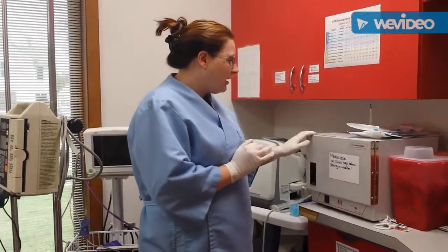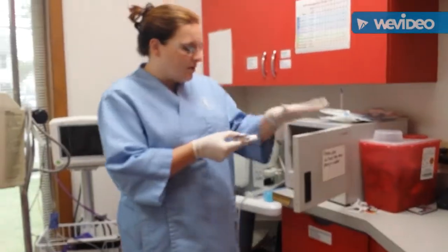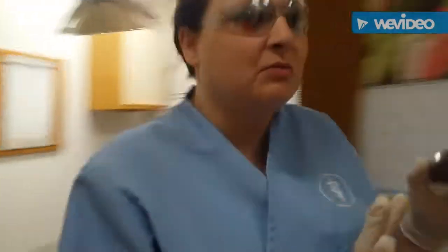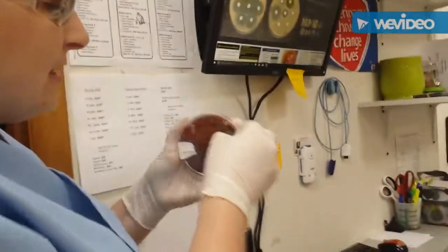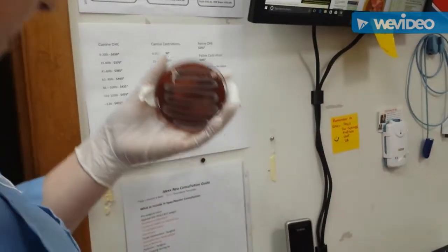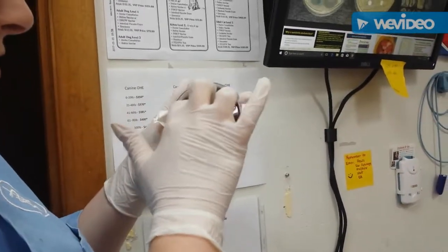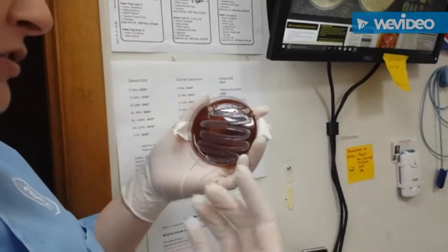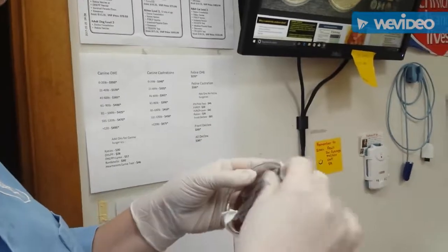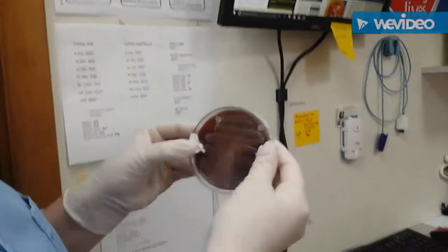Okay, this is the third step of our task 18. We're going to remove our disc from our incubator here, and then walk out to the computer and look at our results and do some comparing. On our disc, as you can see, we used penicillin, and it still continued to grow around it. So it does show that it has a resistance to penicillin at this point. We will let the doctor know so that she can decide if there's another antibiotic that she would like to try.